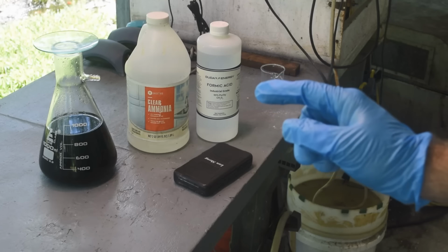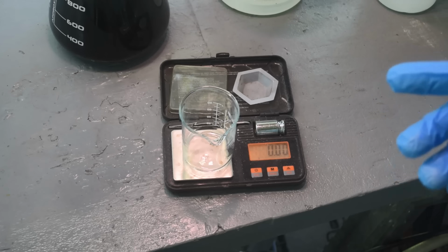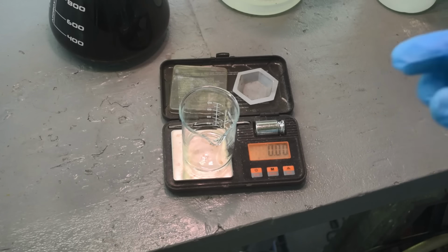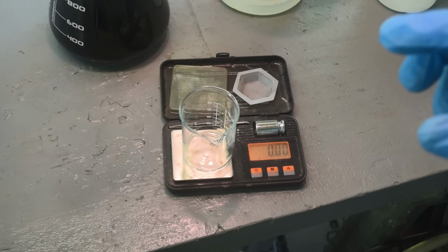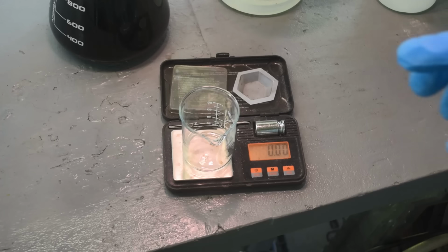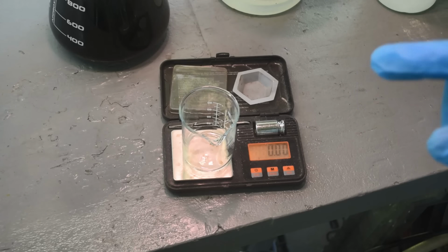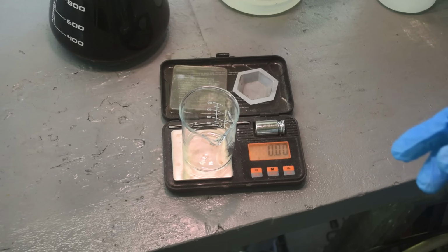First thing I need to do is measure out some formic acid. All right, so for platinum reduction, Hoke says you need about the same weight of formic acid as you expect to get in platinum. And she says further down, for palladium, you'll need a little bit more formic acid, although she doesn't go into great detail about how much more. Now, on the other hand, she does say using extra isn't going to be a problem. You can't use too much.